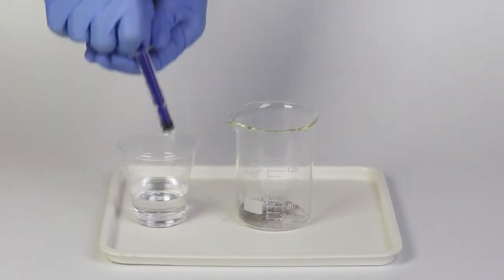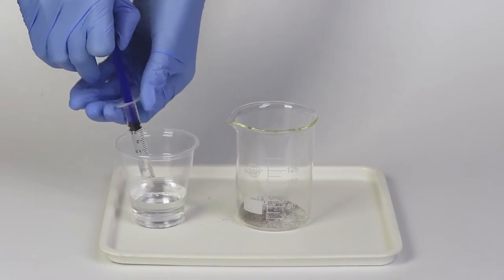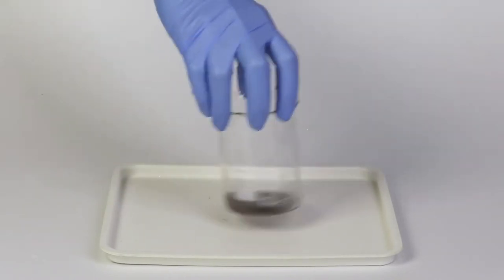Then, using the syringe, measure three milliliters of water and add it to the beaker. Mix the contents thoroughly.